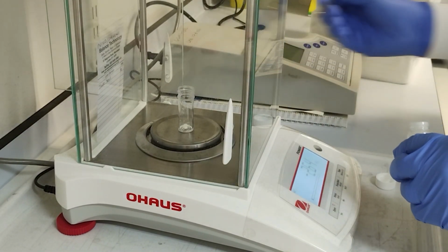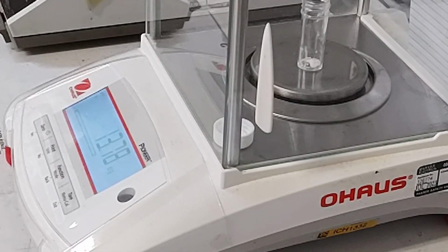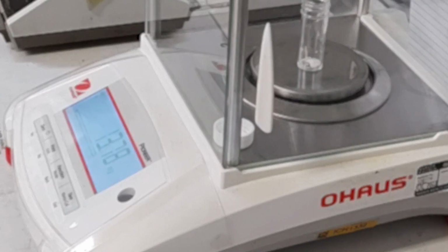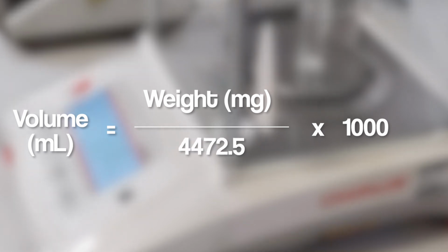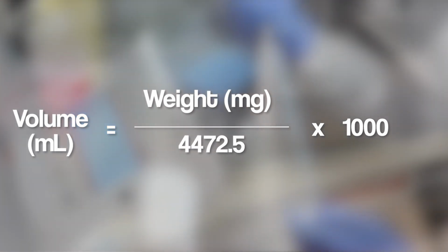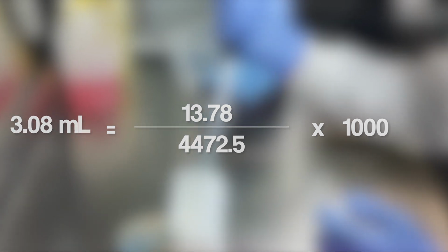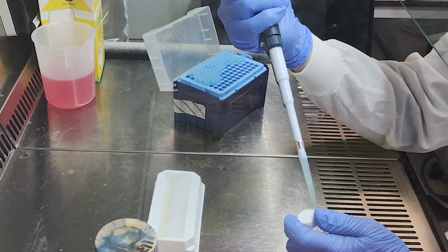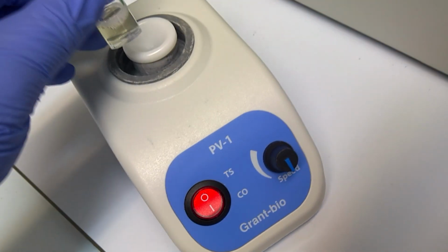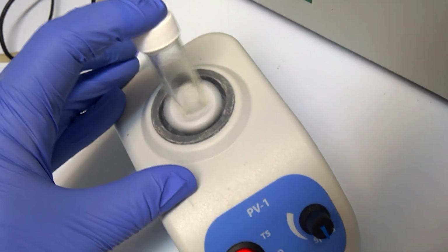Take care not to touch or move the vial. Okay, that will do. It's close enough. Now we can calculate how much liquid to use to dissolve the antibiotic. We want 4472.5 micrograms per ml, and we have 13.78 milligrams, so we will need to dissolve in 3.08 millilitres. If your drug will dissolve in growth media, then it will be okay to use that, and it will make life a little easier later on. Mix well and make sure it's completely dissolved.